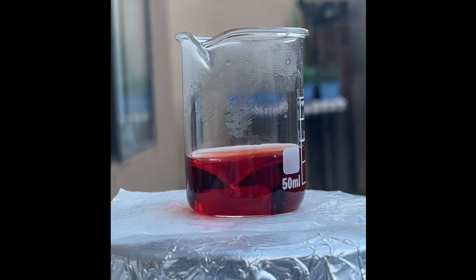The color change oscillated every 40 seconds or so, even though I had turned on the heat plate. This was a significant difference from the 23 seconds of oscillation time observed in the Ferroin-only version at room temperature on a winter day. Since I had left the heat plate on, you can see that the color changes become more frequent over time.